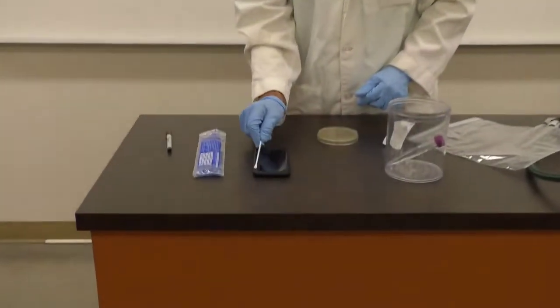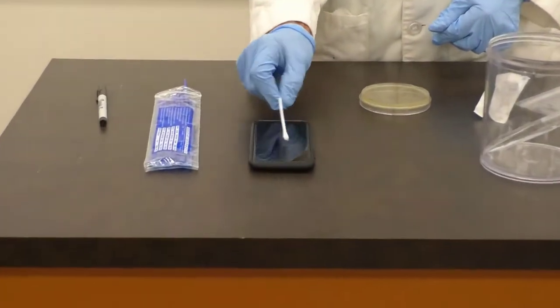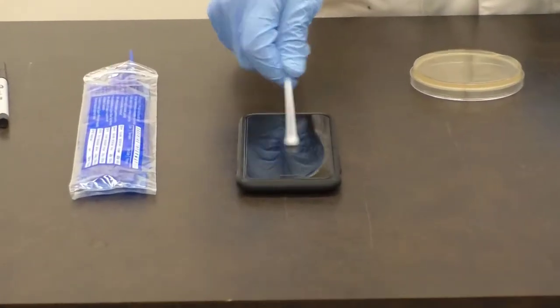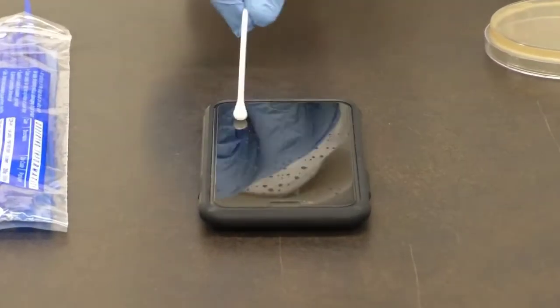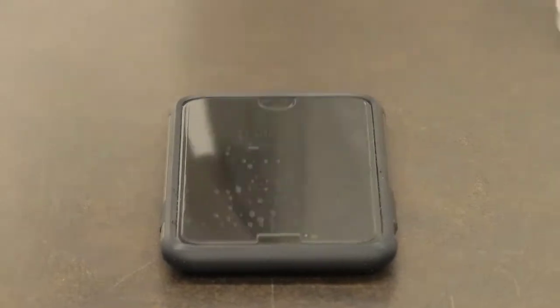And I'm going to swab the surface of my iPhone, rotating the swab back and forth. So I picked up some microorganisms.